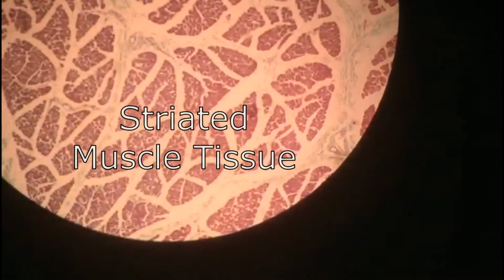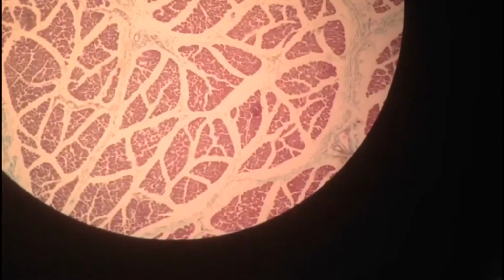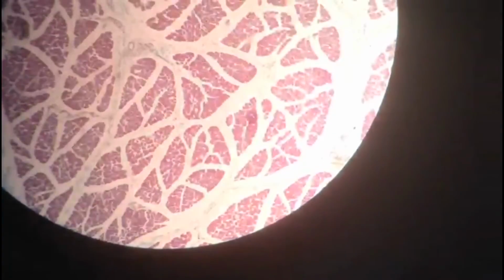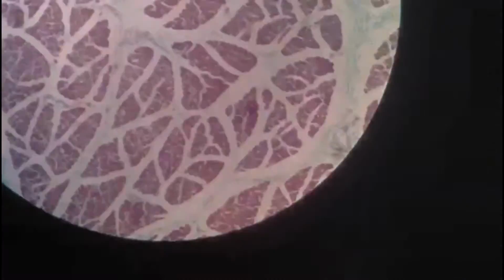Okay, the last slide that we are going to observe is the striated muscle of the cardiac muscle tissue. Okay, striated muscle is a muscle tissue that features repeating functional units called sarcomeres, in contrast with smooth muscle tissue.